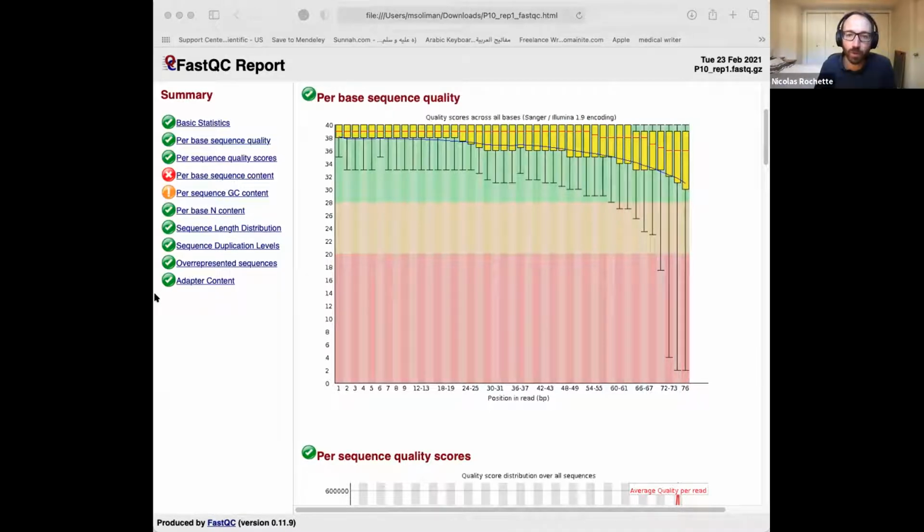And these are moderately short reads. And this is not even the latest generation of Illumina machine. But essentially, even at the end of reads, the typical quality is way above 20. So as I mentioned, with Illumina, under 20 is really subpar, between 20 and 30 is okay, and above 30 is really good. That's a 1 in 1,000 chance for an error, 10 to the -3. So essentially the quality overall is good.